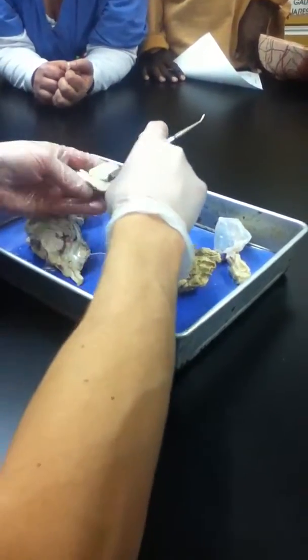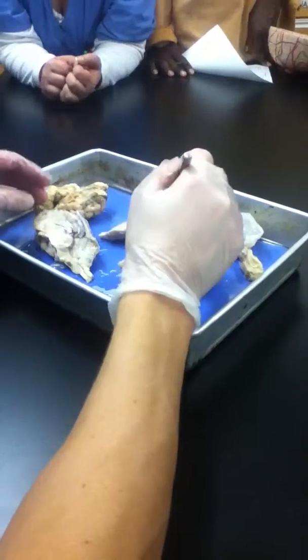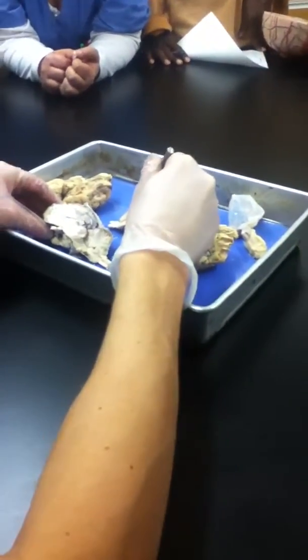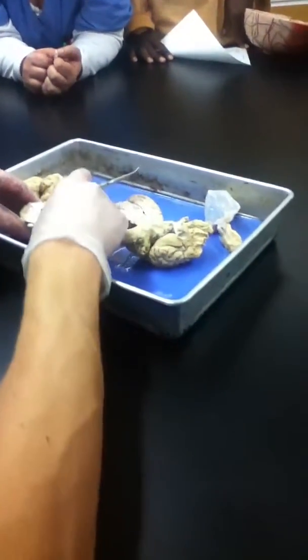Okay, now. Could you tell it on the other side, in the front part, on this one? Remember how you showed us on the slide? Yeah, like the fourth ventricle, we're going to see that in a second. Yeah, that's there. Yeah, they're all here.